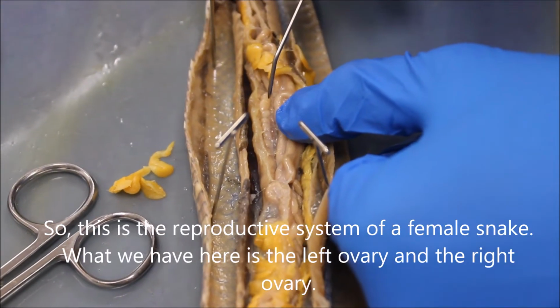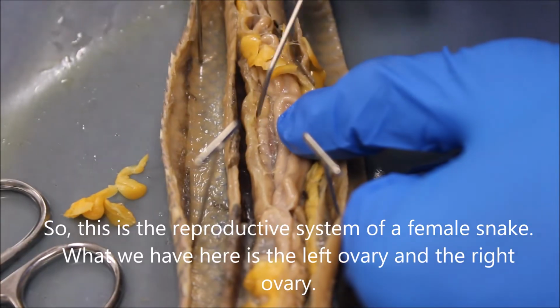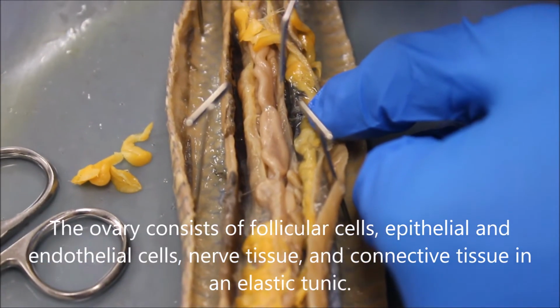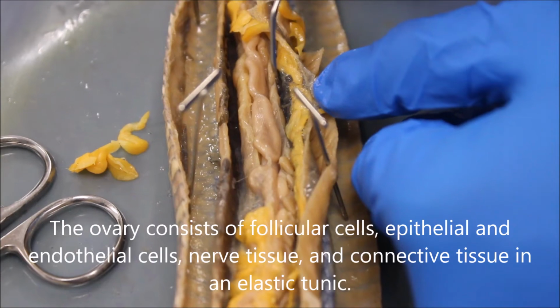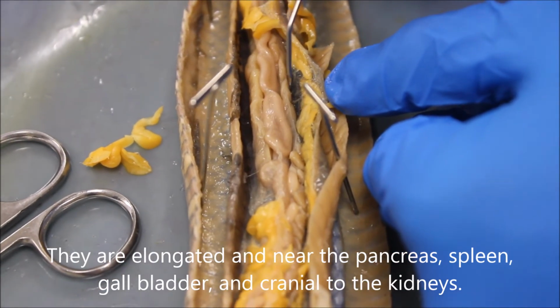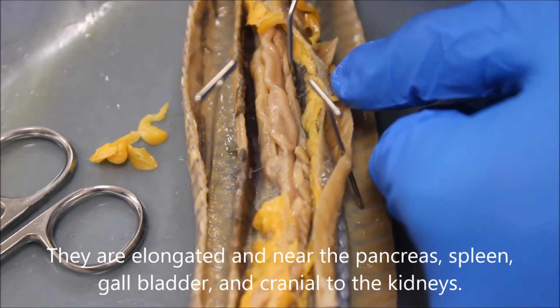So this is the reproductive system of a female snake. So what we have here is the left ovary and the right ovary. The ovary consists of follicular cells, epithelial and endothelial cells, nerve tissue and connective tissue in an elastic tunic. They are elongated and near the pancreas, spleen, gallbladder, and cranial to the kidneys.